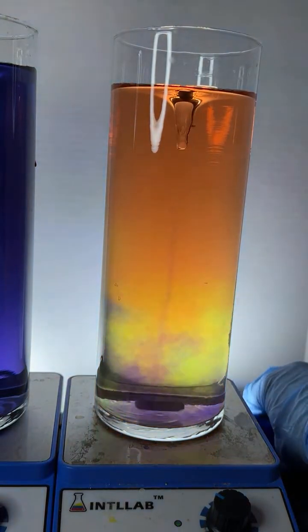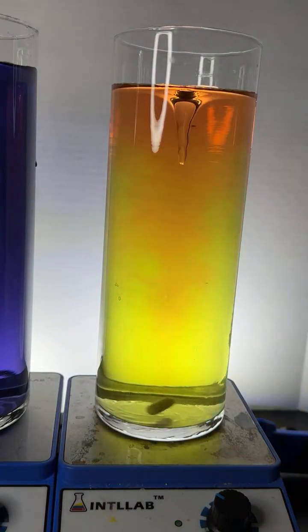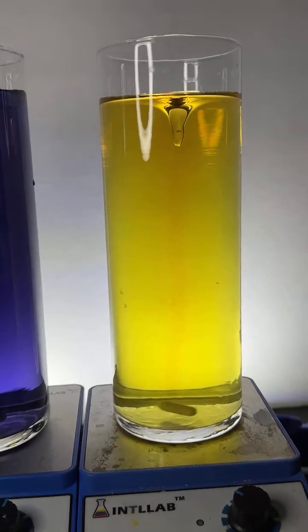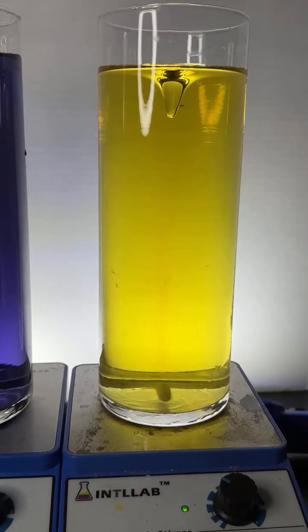I want to see if I can get the light just a bit better. It's going pretty good, IG. Thank you there, Simon. I think it's looking pretty cool, too. It's just kind of fun, you know? What's the name of the pH detector, asks Cassidy.